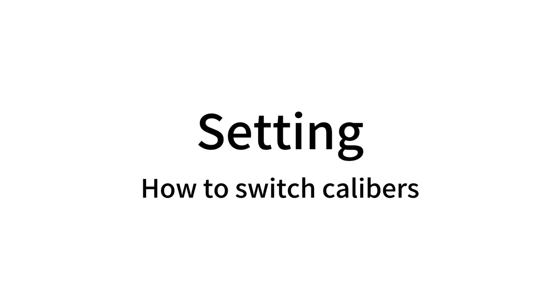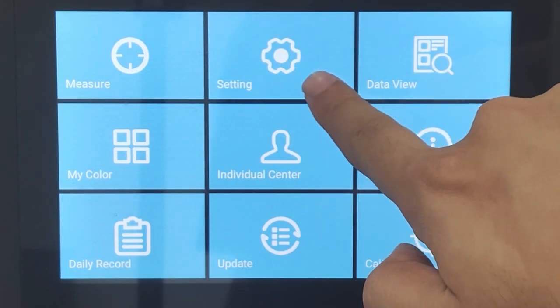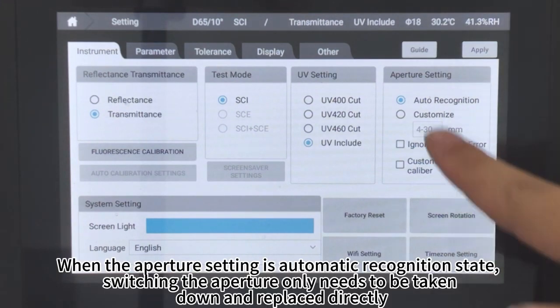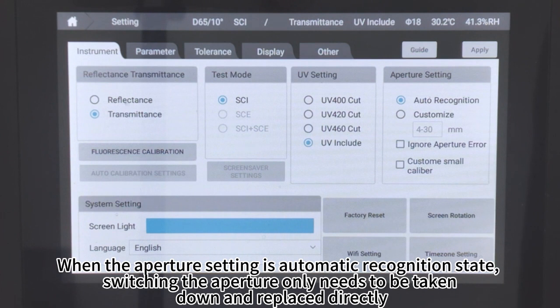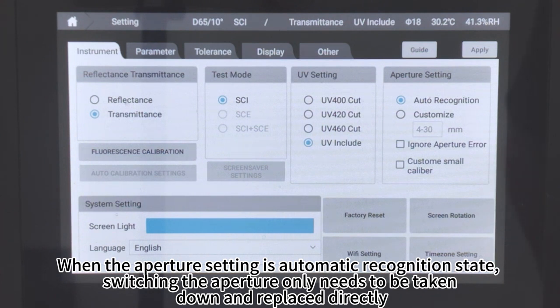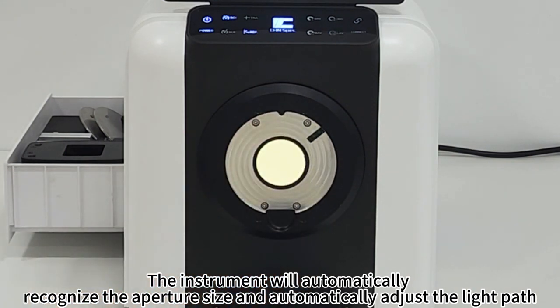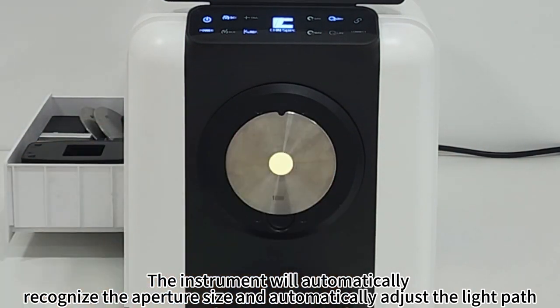Click Set to confirm settings. When the aperture setting is in automatic recognition state, switching the aperture only requires removing and replacing it directly. The instrument will automatically recognize the aperture size and automatically adjust the light path.